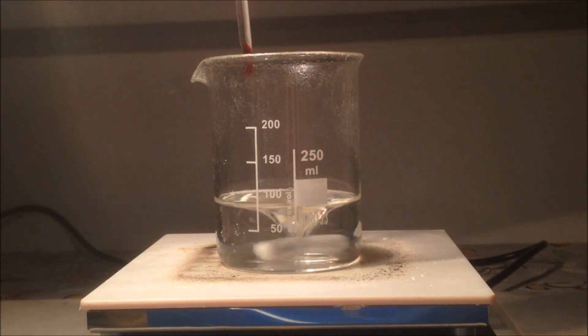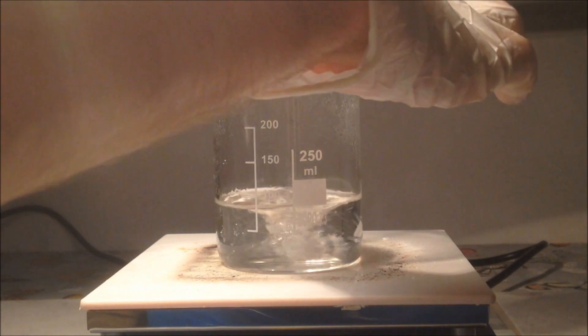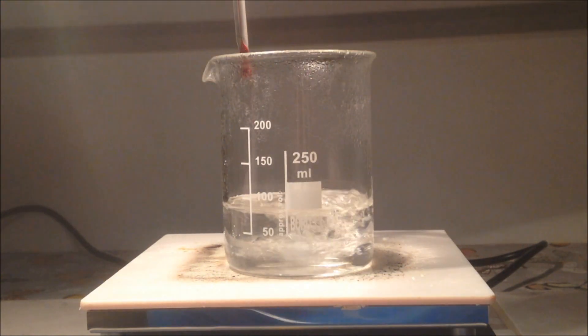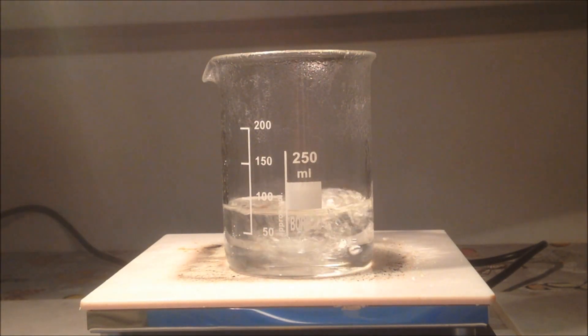I then went on to boil down the solution to concentrate it as much as possible. I used this thermometer to make sure I was below 100 degrees, as it shouldn't decompose, but I've worked with things like sodium ethanoate and I'm still a bit paranoid about decomposition.